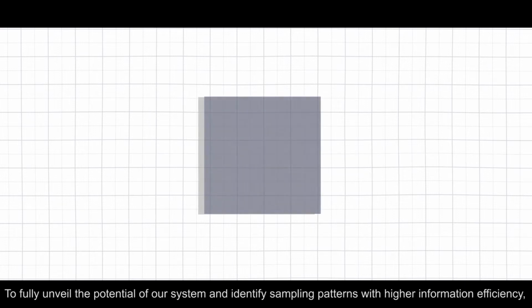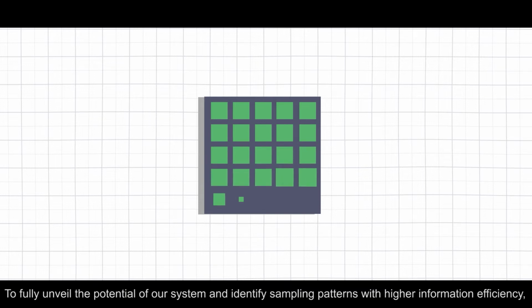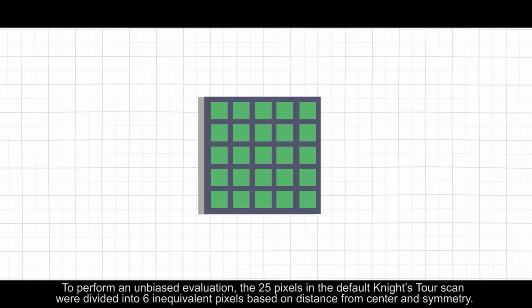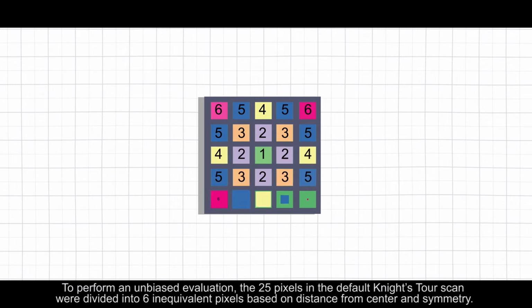To fully unveil the potential of our system and identify sampling patterns with higher information efficiency, we begin searching for the optimal sampling pattern in the XY plane. To perform an unbiased evaluation, the 25 pixels in the default Knight's Tour scan were divided into 6 inequivalent pixels based on distance from center and symmetry.